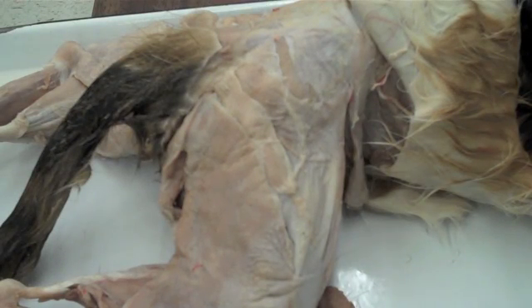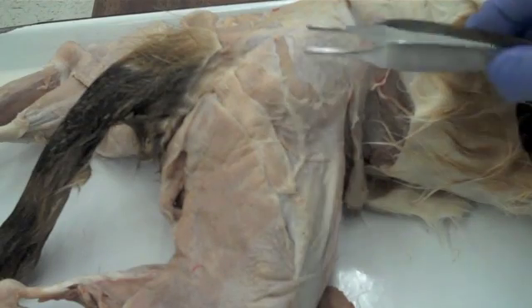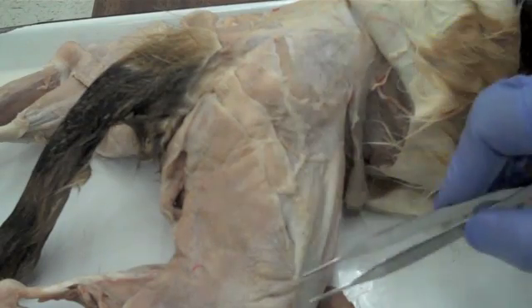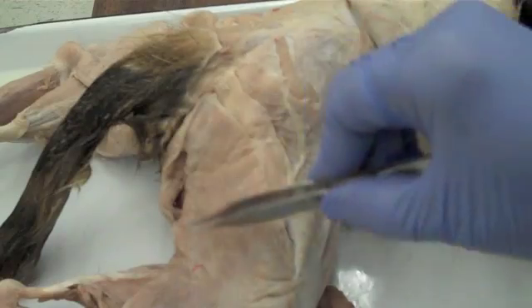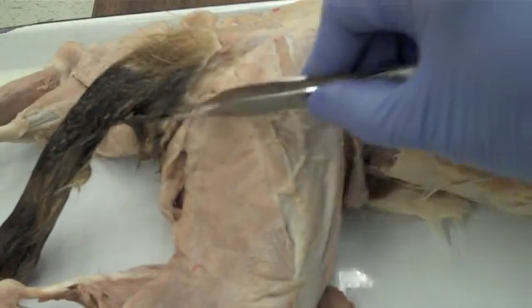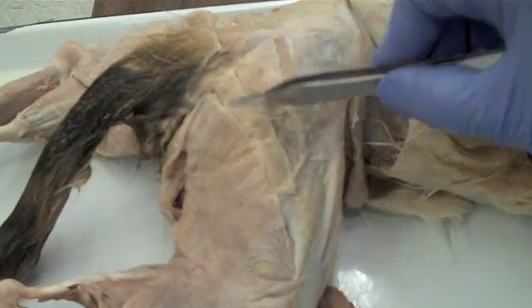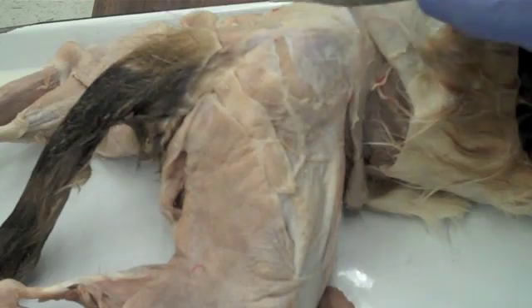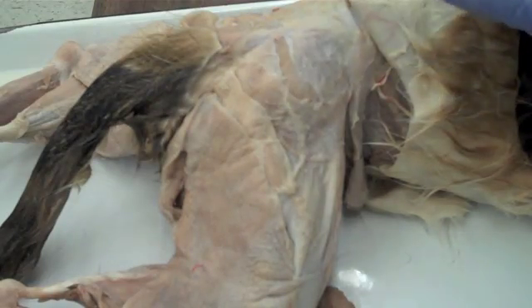This is the right lateral thigh of a cat. We're going to walk through the different muscles that are visible here. Down here we have the hamstring group, and up here we have the glutes and some other muscles as well.